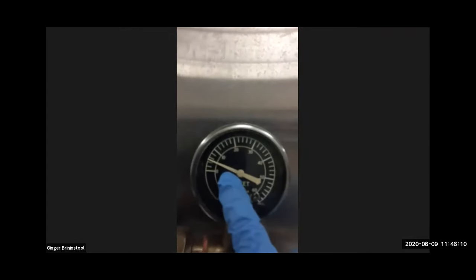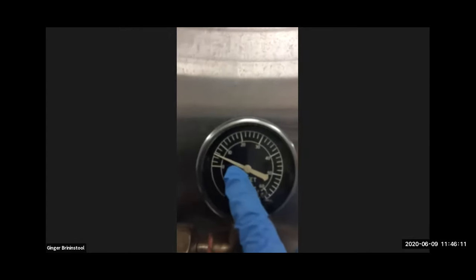Here's the pressure, it's starting to move. And it'll make its way to 15 psi. And then the temperature has also started to move. And as it goes up, the pressure inside changes, it's going up, the temperature's going up, and we leave this exhaust valve open until the temperature reaches 100 degrees Celsius. And at that point, we can close the exhaust valve, and the temperature will keep increasing until 121 degrees Celsius is reached. That usually takes about 5 minutes to happen.